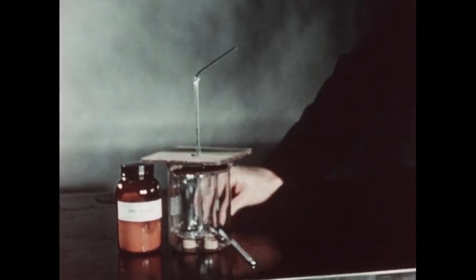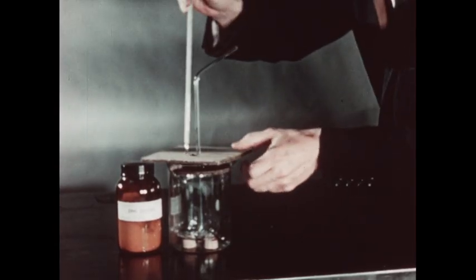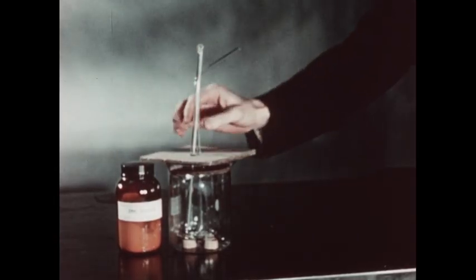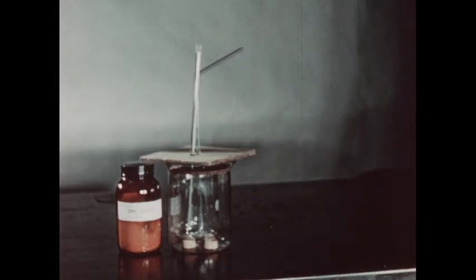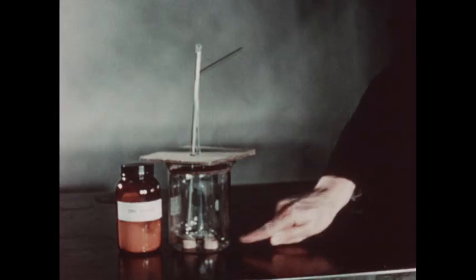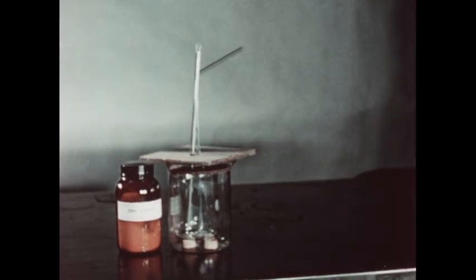A thermometer is now inserted through the 2 cardboard covers. This thermometer is graduated in 1/5 of a degree so that accurate temperature readings may be obtained. The inner beaker is supported on 3 corks to insulate it from the bottom of the larger beaker. The larger beaker serves merely as a container and screens the smaller beaker off from outside conditions.